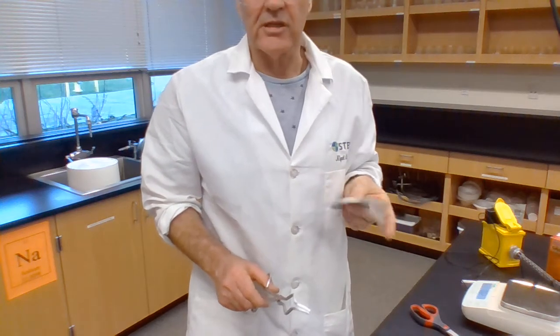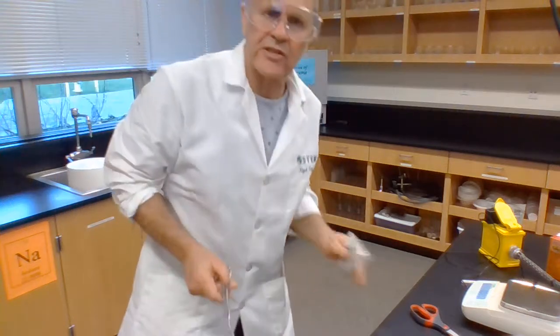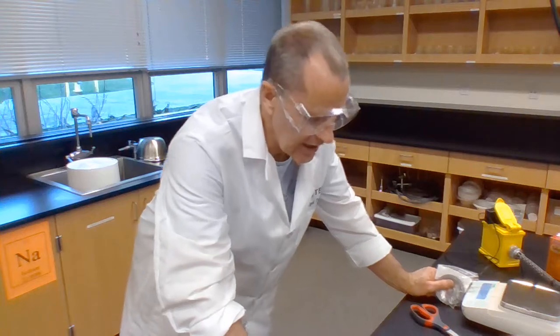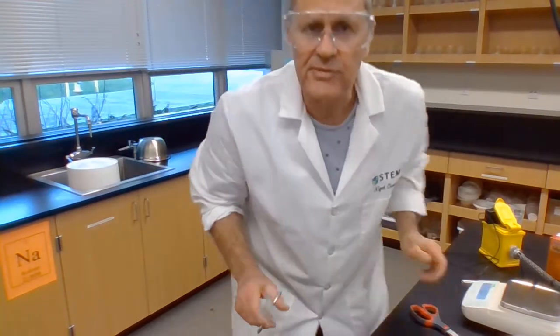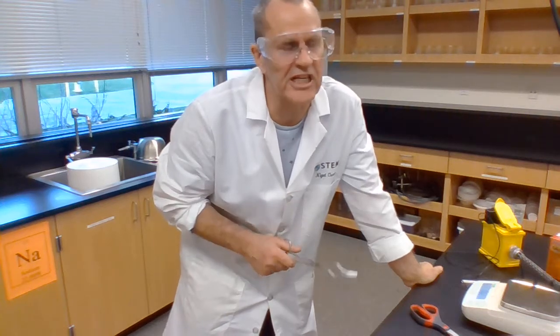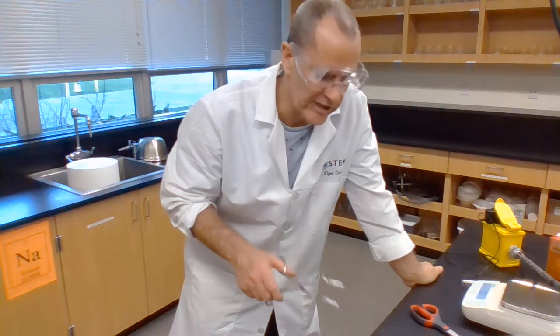And what we're going to do is a combustion reaction. So it's going to react with this excess of oxygen that's all around me here, O2, gas. So how we're going to do that is we're going to heat the magnesium in a crucible, or, because we're in a hurry, we're going to heat it a bit out of the crucible, and it really is going to be a quick and dirty reaction.